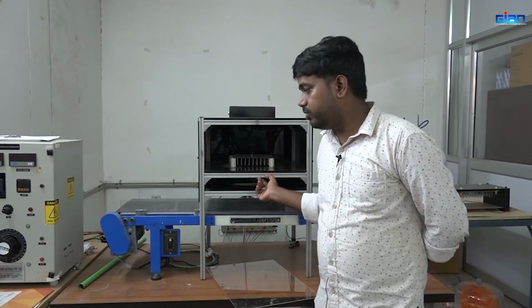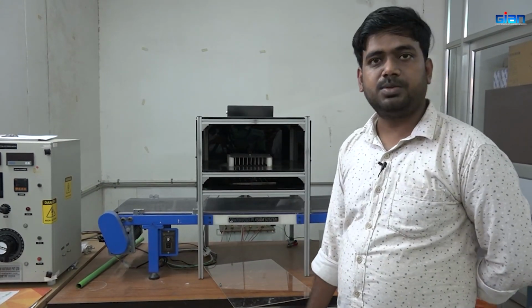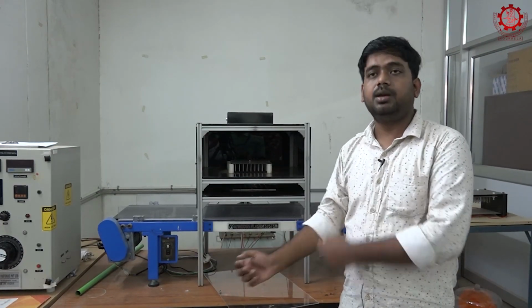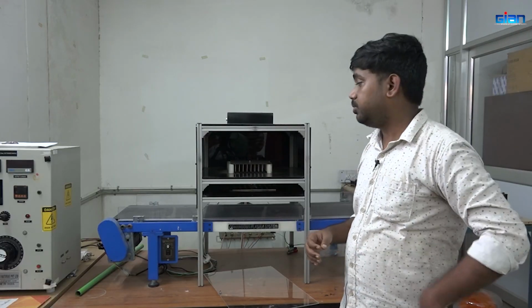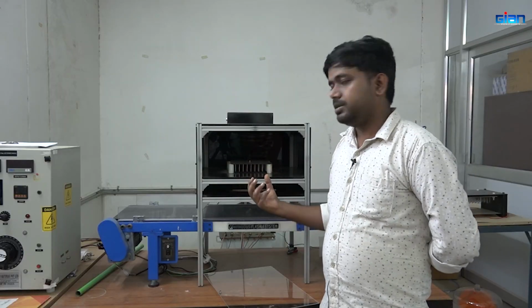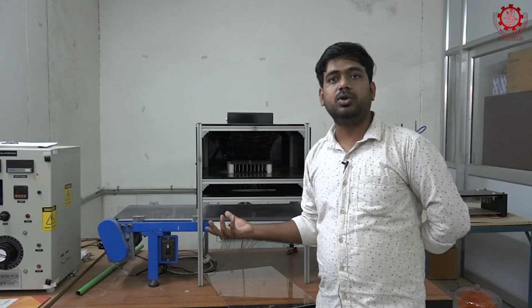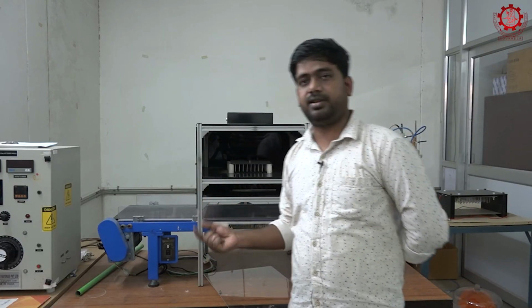So before going for this demonstration, basically we go for some theory. Cold plasma was initially used to deactivate microbes, seeing its advantages in various food applications. Right now it is getting popular due to its various advantages, such as you can modify the starch and proteins, we can manipulate other proximate composition, as well as we can reduce the anti-nutritional factors also.